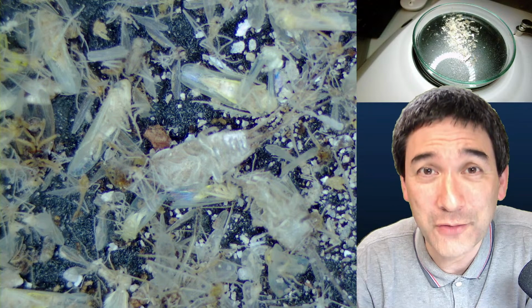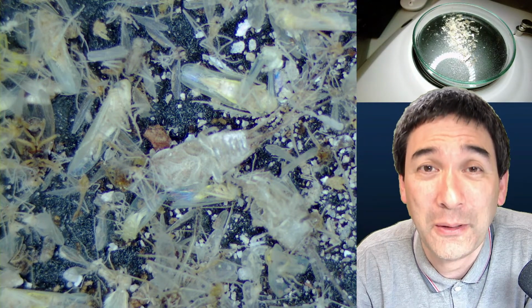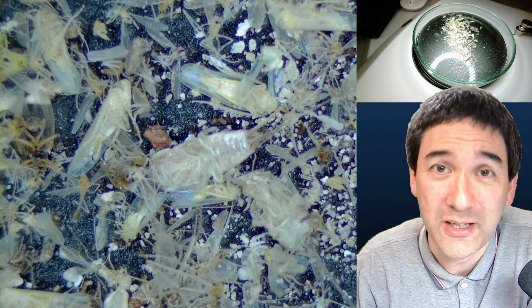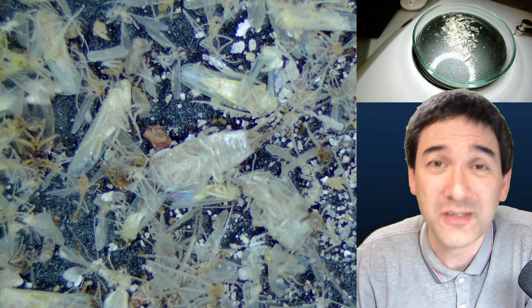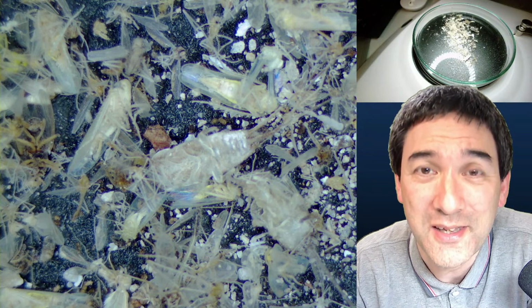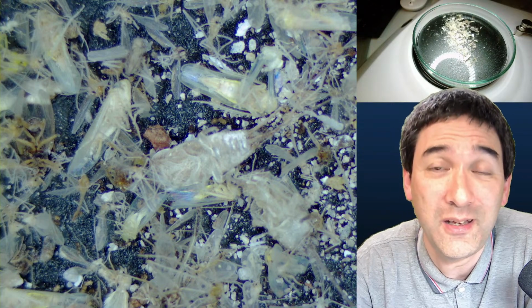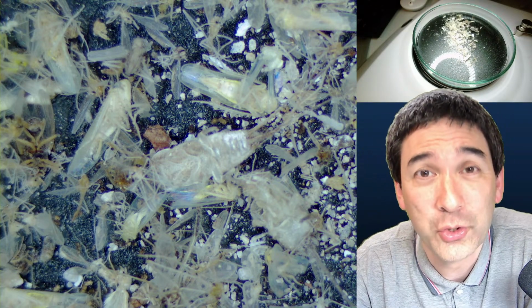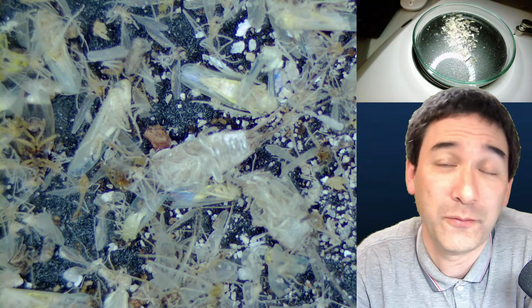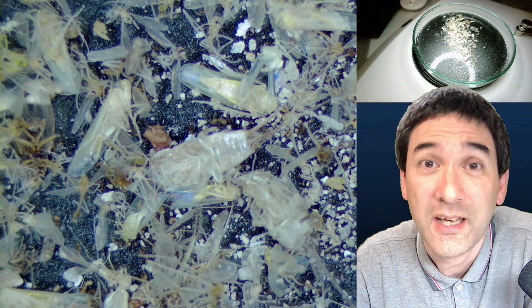My philosophy is just buy yourself pretty much any microscope which is not a toy microscope, and just learn. And then you upgrade. So that's one possibility. And it doesn't take a lot of money, right? It's just to get your toes wet, as one says. Then there are other people who say, well, what you should do is you should not buy yourself a new cheap microscope. You should rather go out and buy yourself a refurbished quality microscope. Like, for example, a good Leitz or Zeiss microscope from the 1970s or 80s, which has been refurbished.